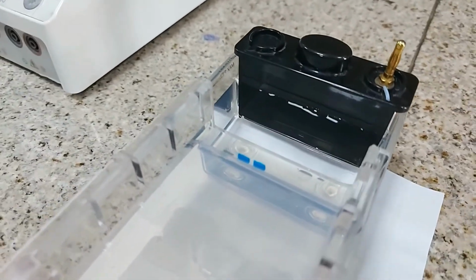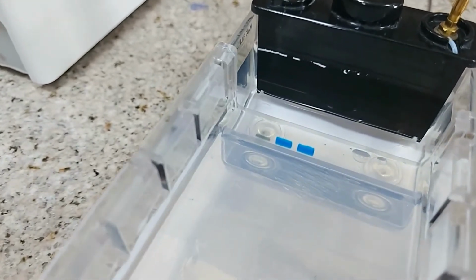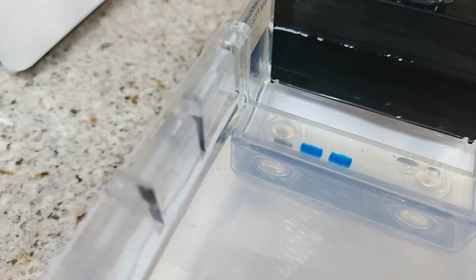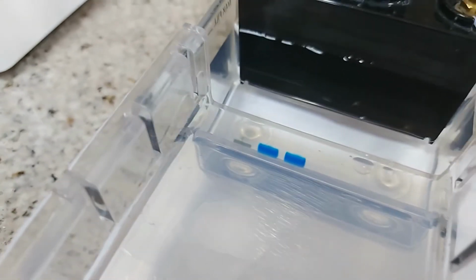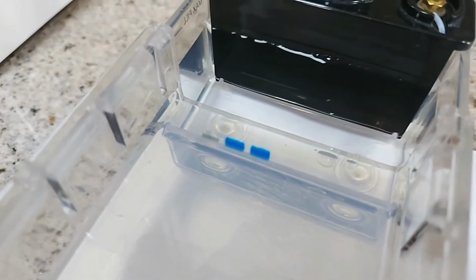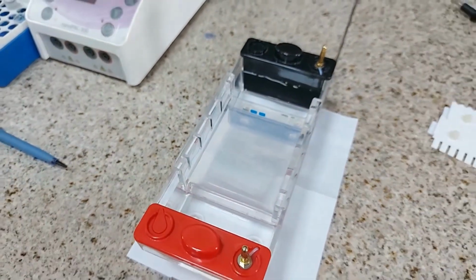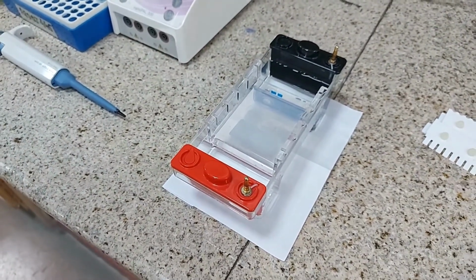So you can see it. The plasmid DNA is visible by a lower amount of dye. That is the 1 kb ladder, okay? The plasmid DNA is next to it, and then is the genomic DNA. So the 3 wells have been done on this gel, and the gel is now ready for running at 60 volts.